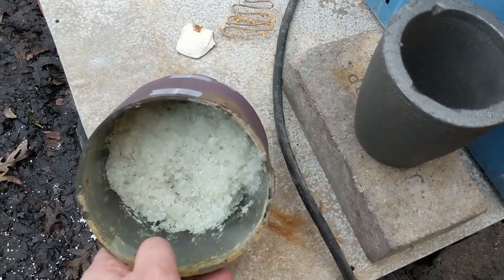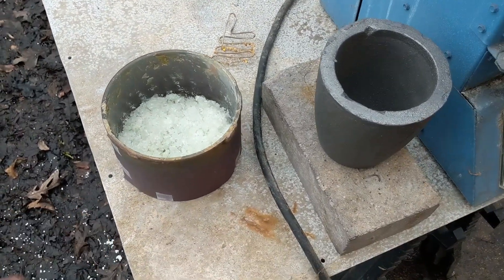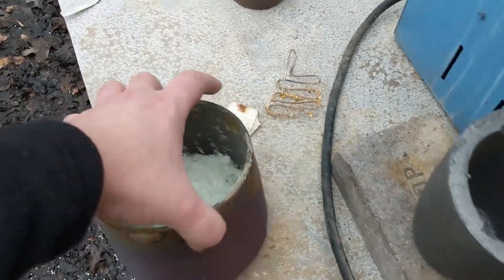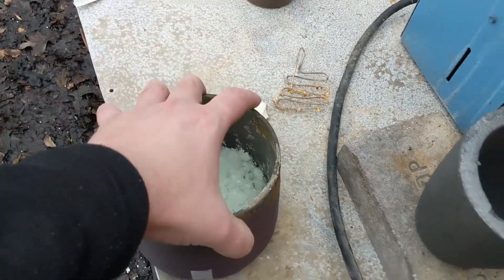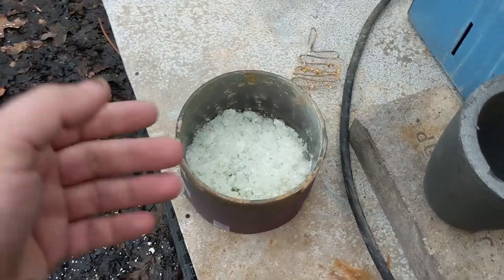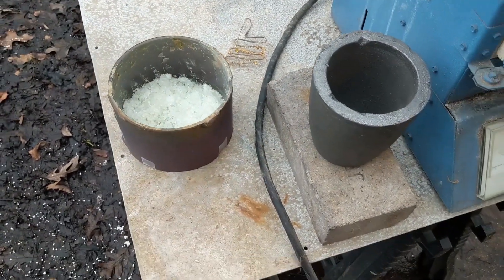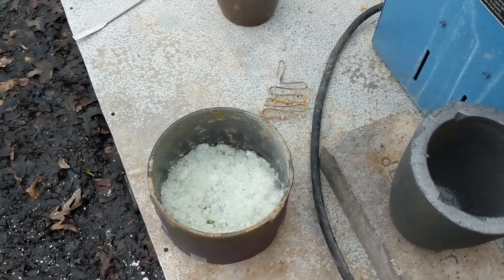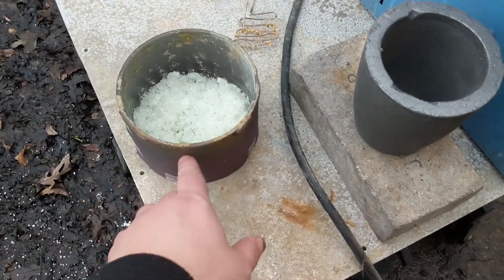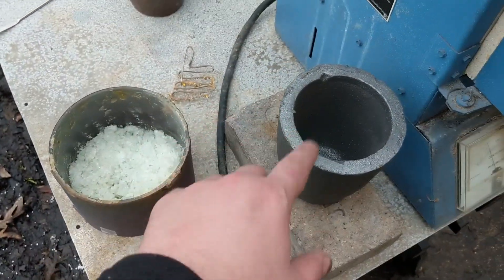There's quite a bit of silver nitrate in here — I broke it up just a bit ago. There are also some crystals on the paper that I used to block the light out. That's from creep. If you're letting a dish dry out and crystallize, you'll find that the crystals will grow up the dish and that is pretty much unavoidable — I've not found a way to avoid it yet. I'm going to cut the paper all the way around that has any sort of silver nitrate in it and it's going to come in here as well.